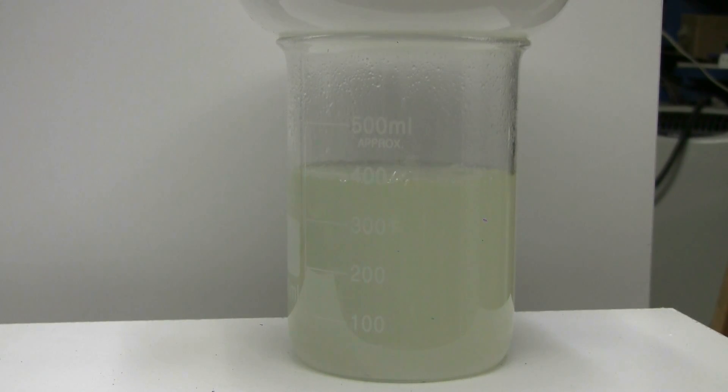What I've shown here is why you use a sep funnel or similar apparatus when doing this reaction to add the acetone drop-wise, drop-by-drop to the bleach solution, rather than adding it all at once, like I did.